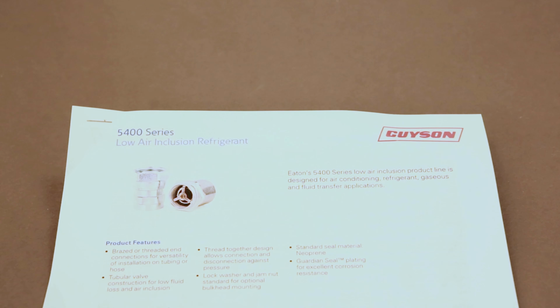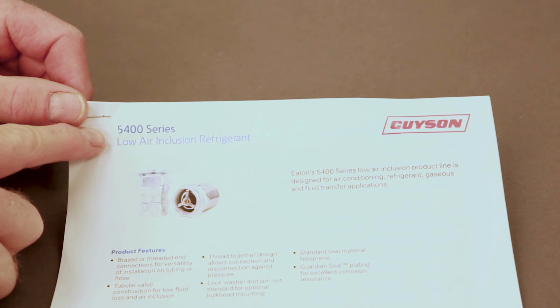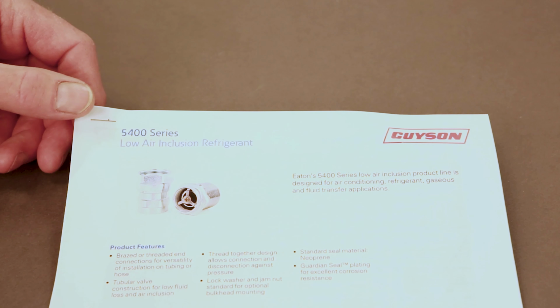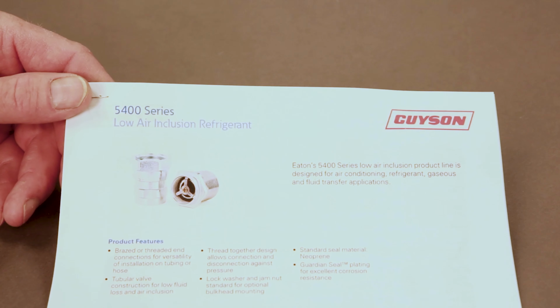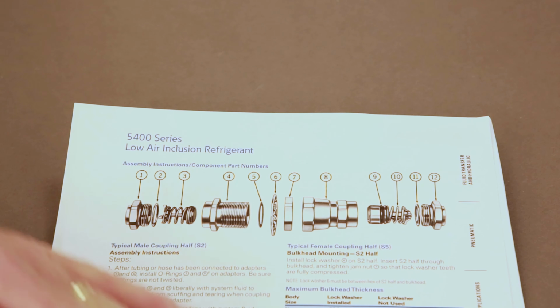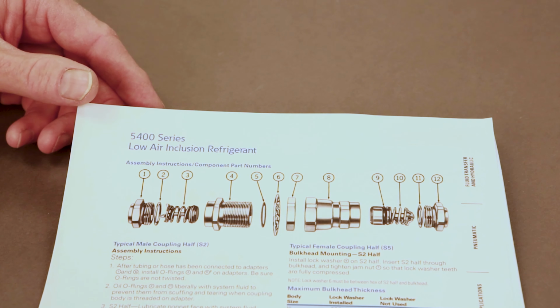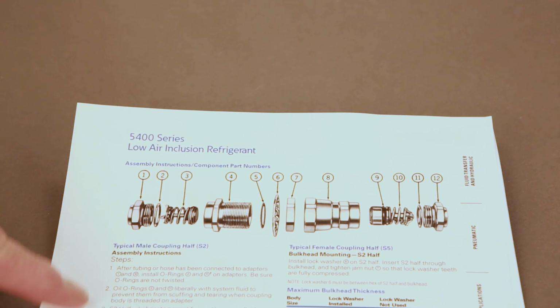Okay, to disassemble and assemble the 5400 series Aeroquip fitting used on the CryoTiger system, there is a document that can be referred to, and in that document is a page that has drawings of the components of the fittings and assembly instructions. So those are good to use.